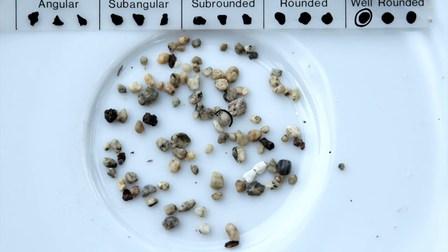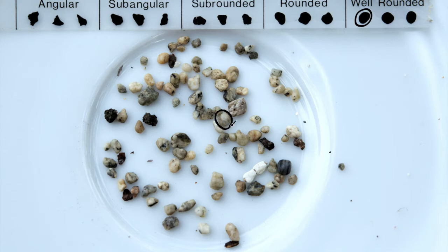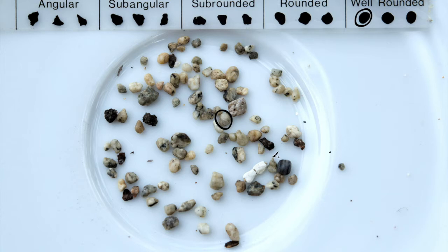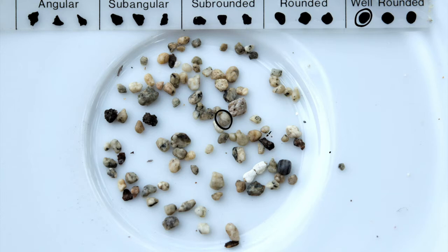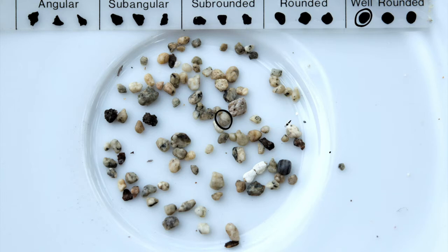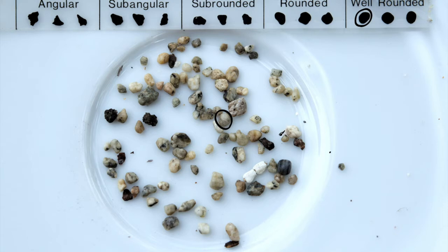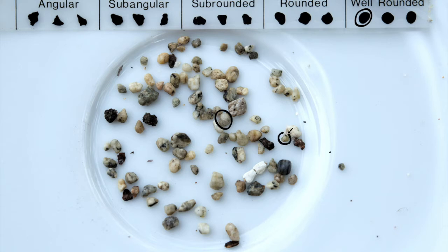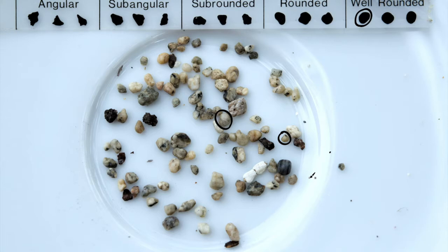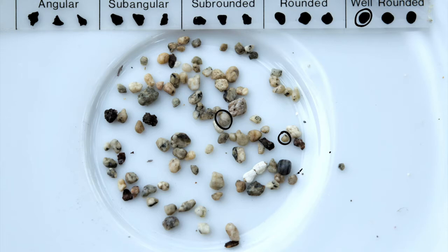This one right here really doesn't have any sharp edges on it at all. Here's another example of one that's a little bit smaller, but still well-rounded — maybe on the rounded side.